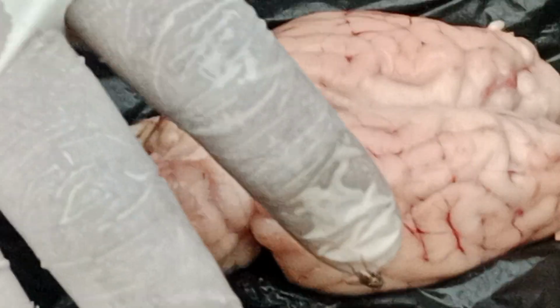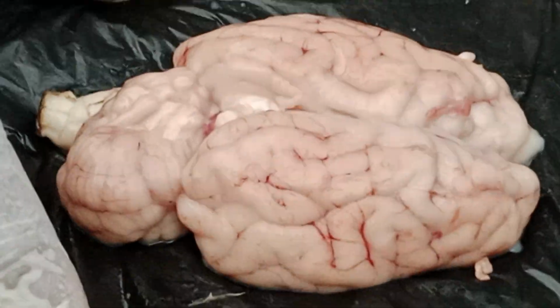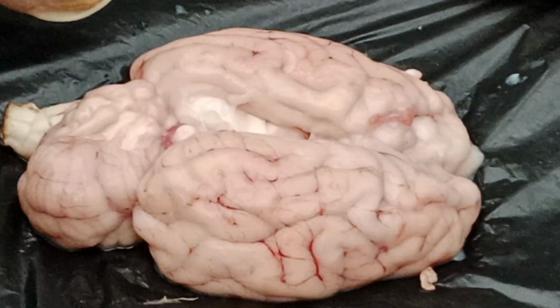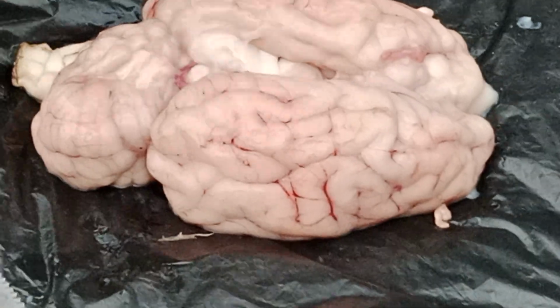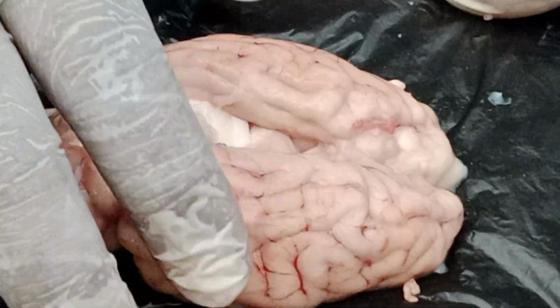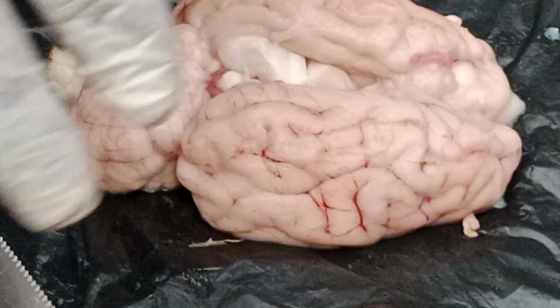Okay, since we have cut, I told you, when the meninges are not there, it loses its shape, and the arrangement will not be there. See, children, slowly can you see that the hemispheres are falling back? Before, it was not happening. Why? The meninges were holding it tight. Now the meninges are cut in the median cleft.